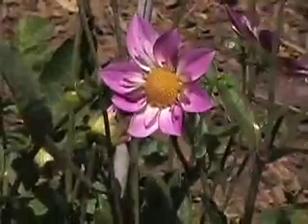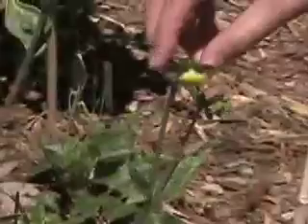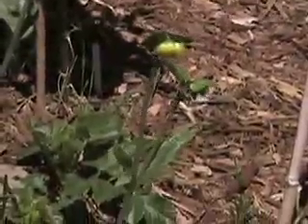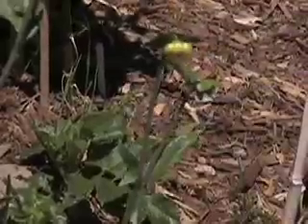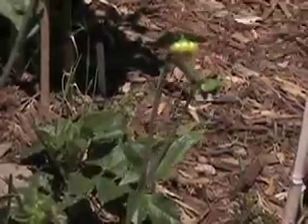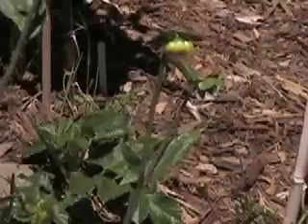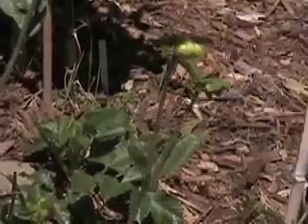What we're going to do is use this aluminum foil to cover one of these buds, and we are going to wait a few days for the flower to open. We'll open the aluminum foil to see if the flower is white or if it looks like this. If it is white, then we have more evidence to believe that there is a light-sensitive promoter in the genome.